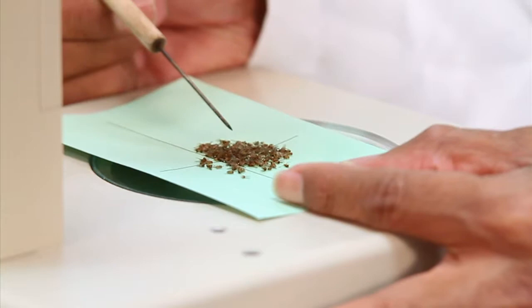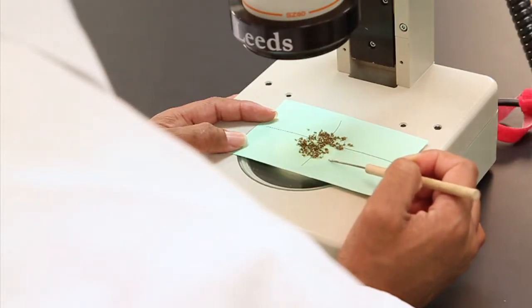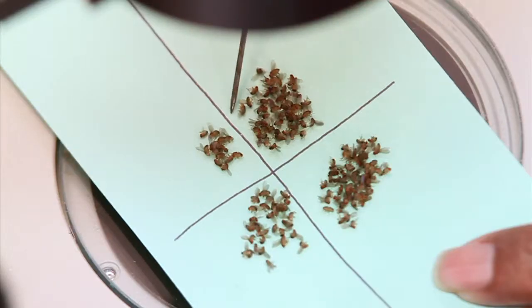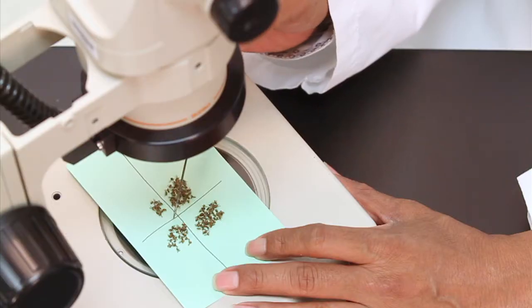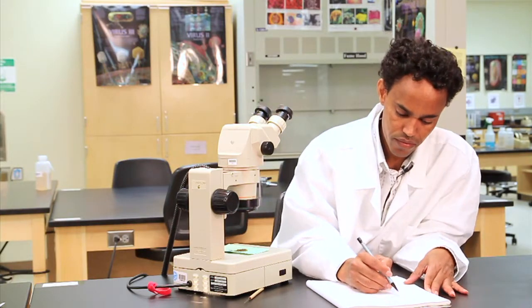Use the dissecting microscope to group flies with similar phenotypes and count their numbers. Ask a CLA or your professor if you need help. You should have a total of 60 to 150 flies. Be sure you record this information in your lab manual.